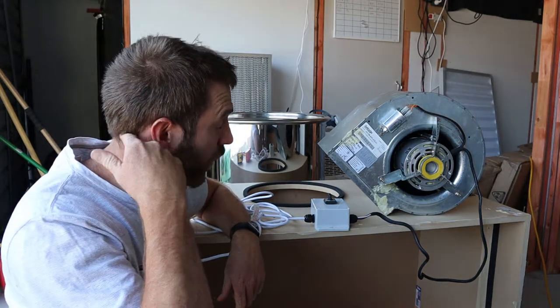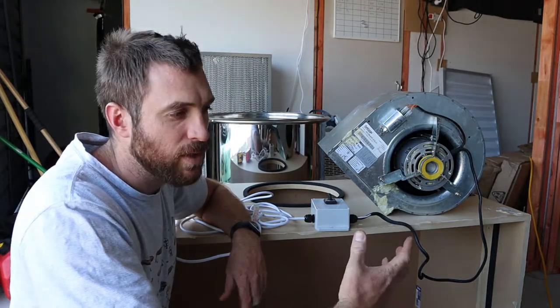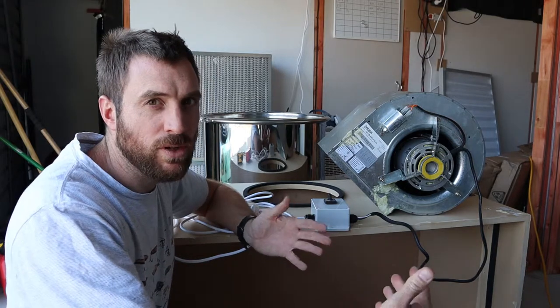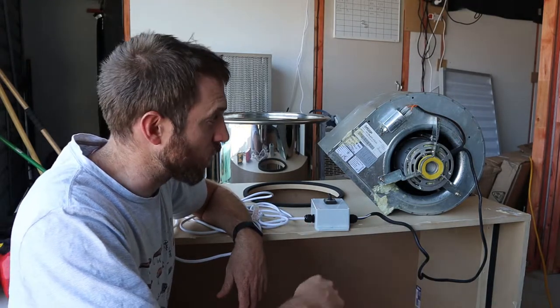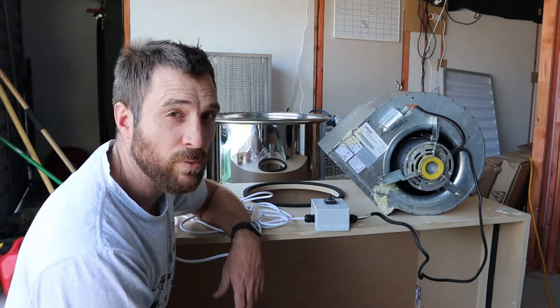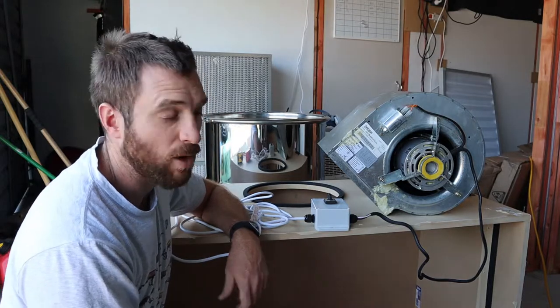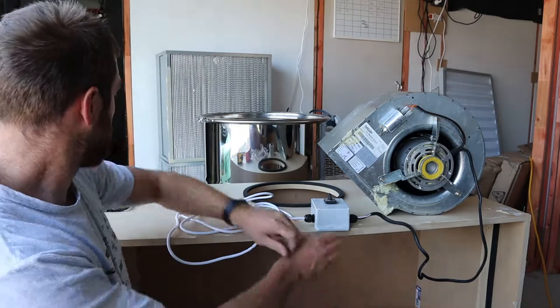And then I've got an option for a medium speed there once the HEPA filters start to degrade and start building up. Once they get contaminants through them, the back pressure really increases on them. So I'll be able to turn it to medium to really push that air through. And I figure after that, the HEPA filters will be getting a bit clogged, so I'll probably just replace the HEPA filter and I shouldn't have a need for that high speed on there. But I'll take you through it.